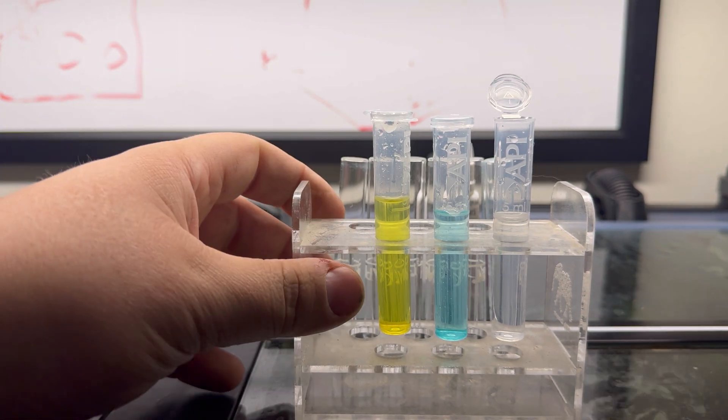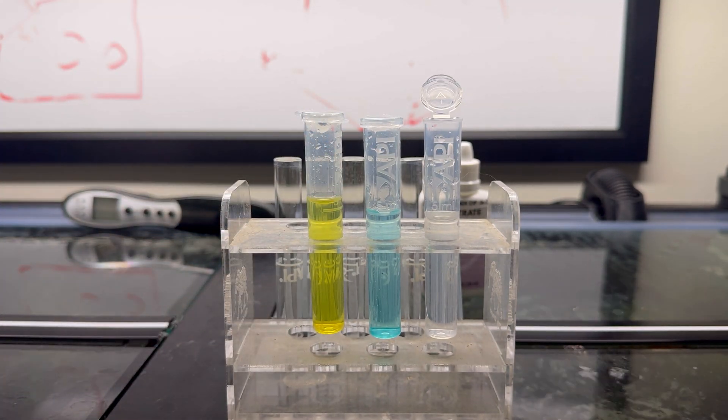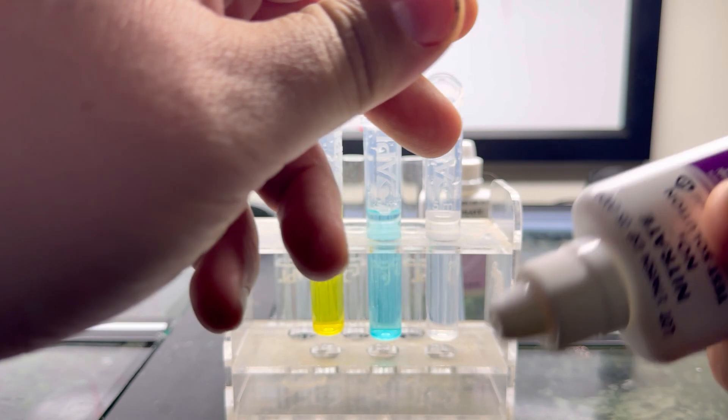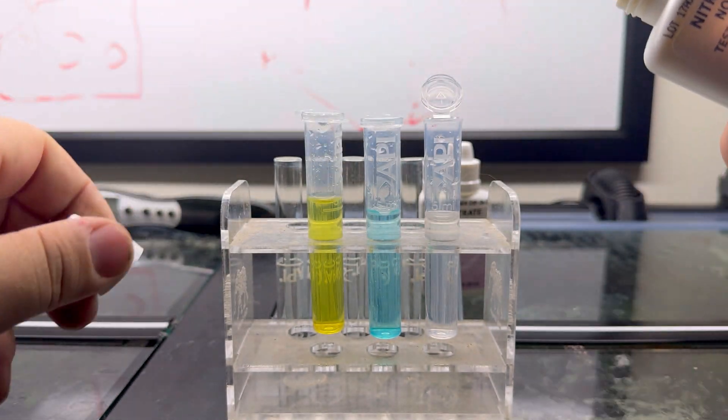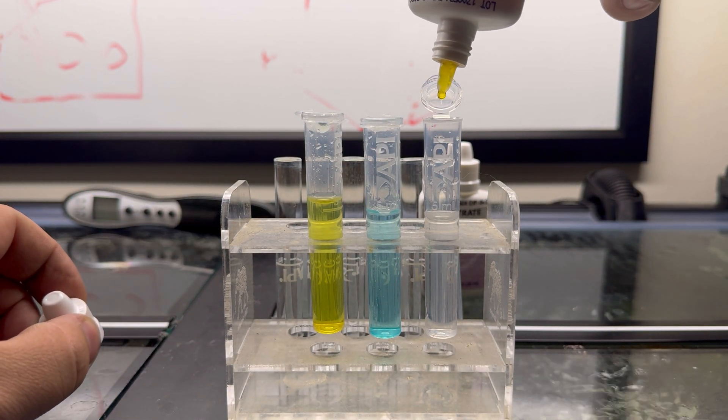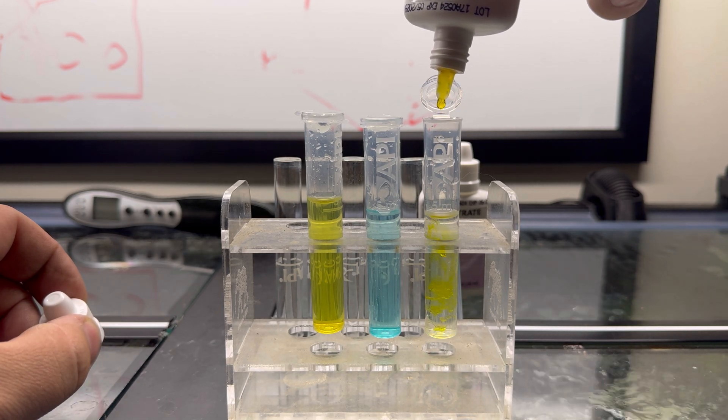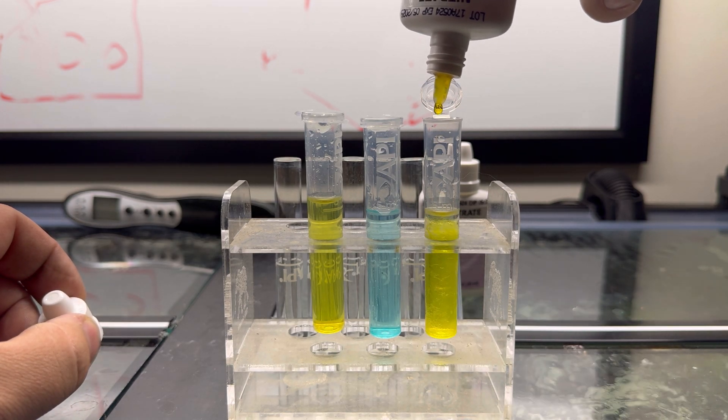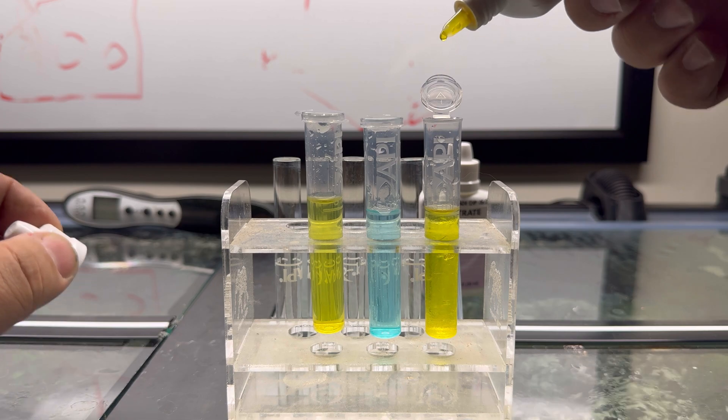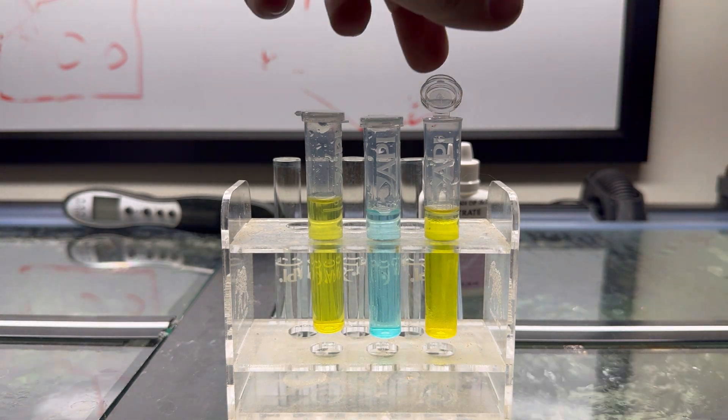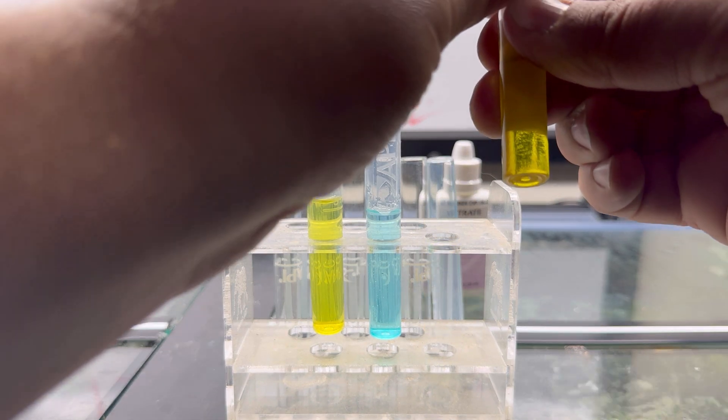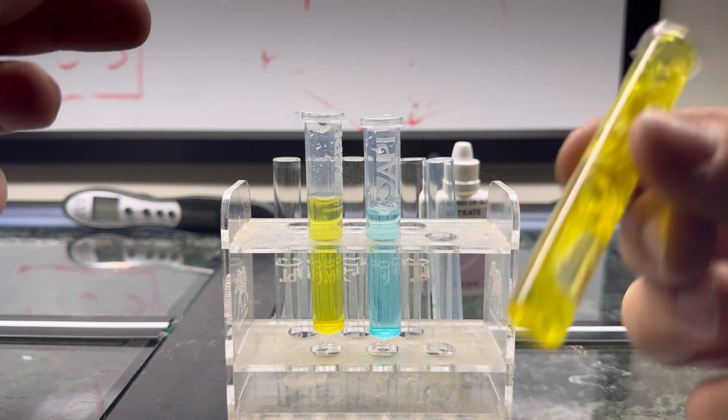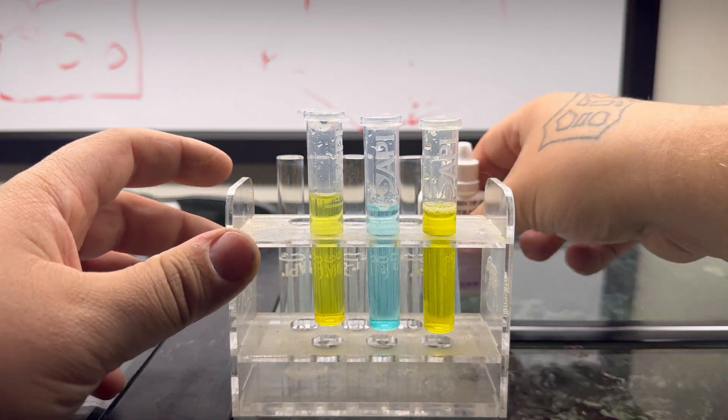We have our other two tests developing as you can see. I always give the bottle a little shake. This is solution number one. We're going to do 10 drops: one, two, three, four, five, six, seven, eight, nine, ten.